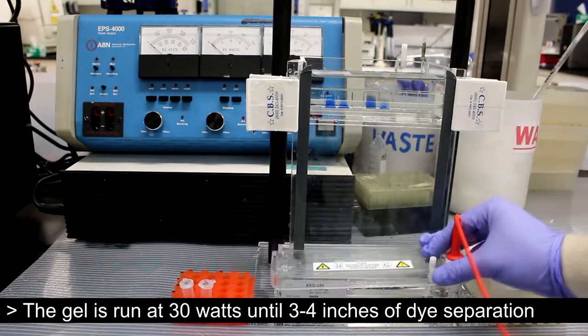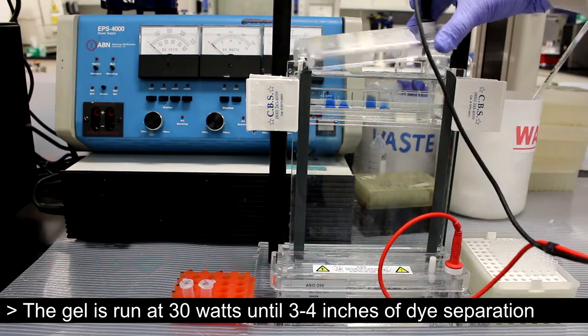The gel is run at 30 watts until 3 or 4 inches of dye separation is achieved.